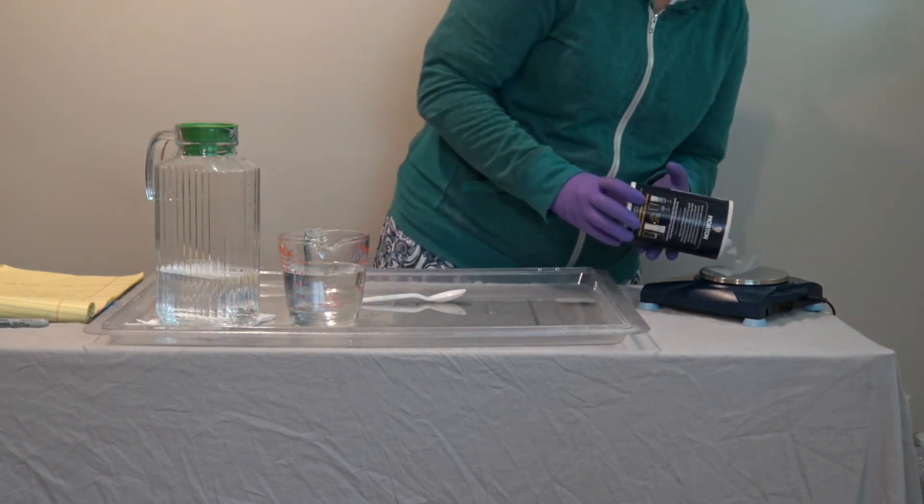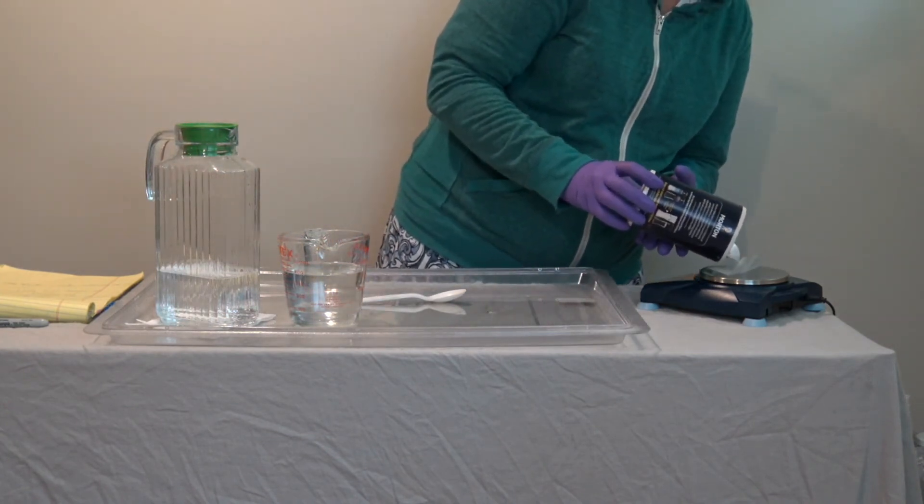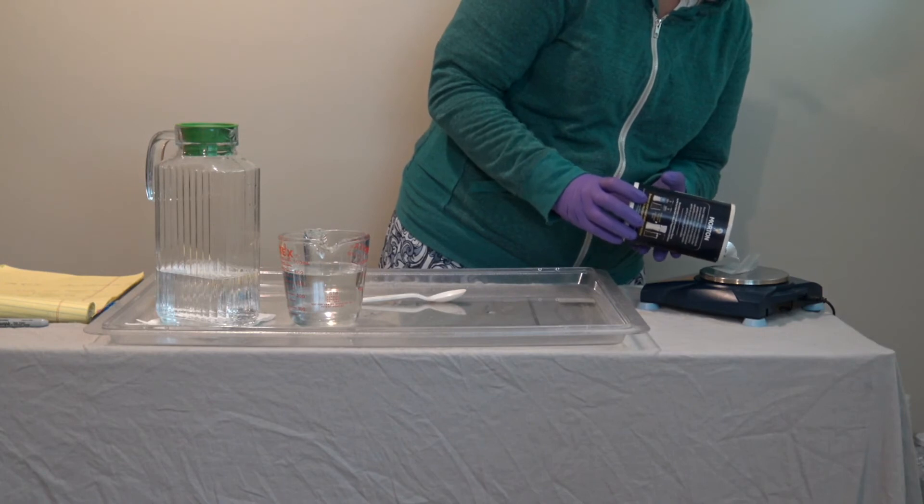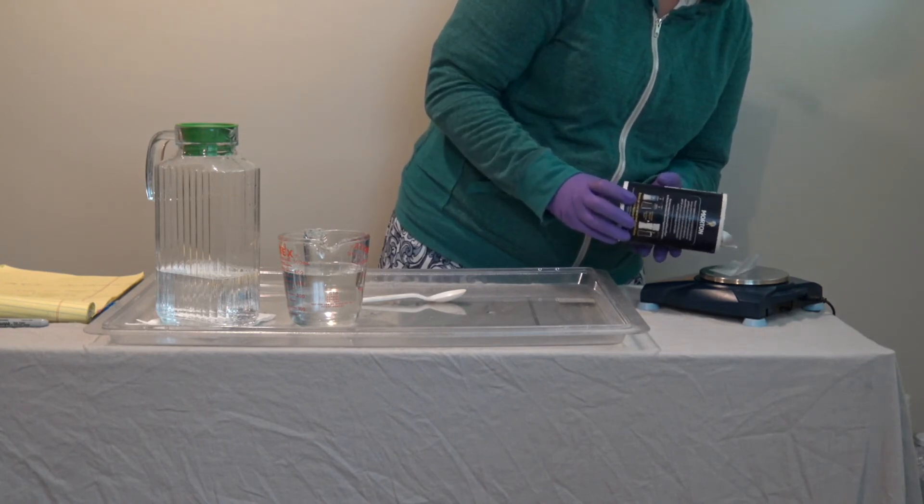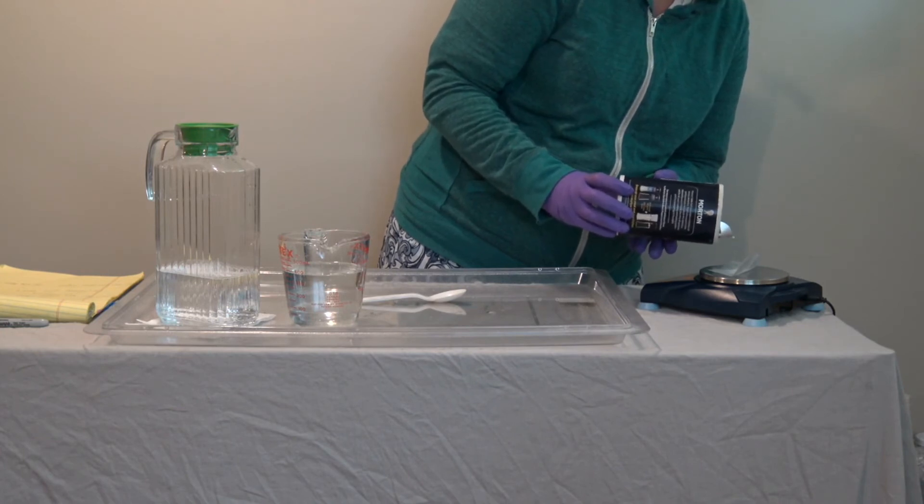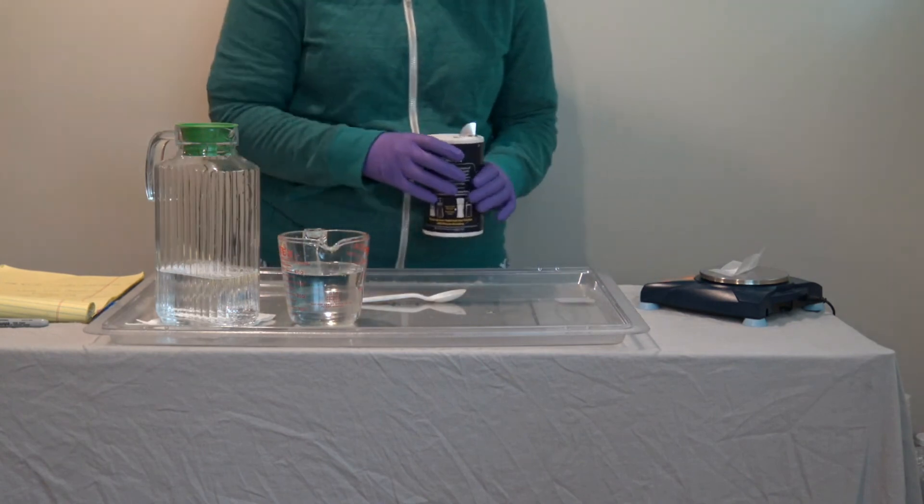I'm going to slowly start adding salt to get to 2.4 grams. And there's 2.4 grams.